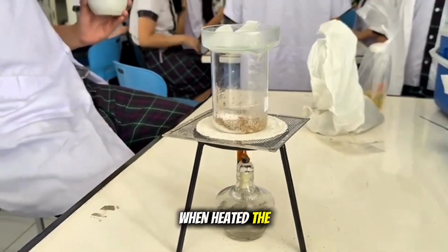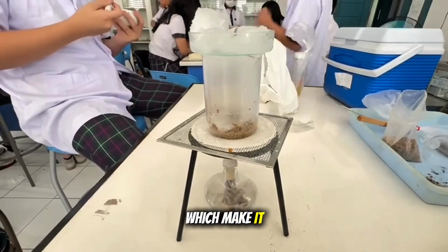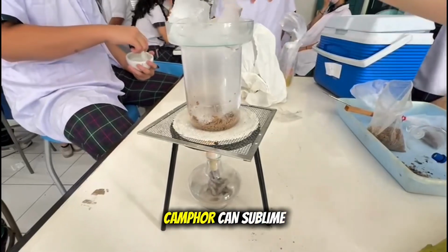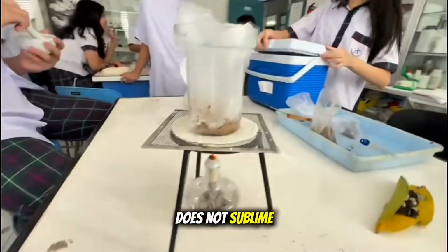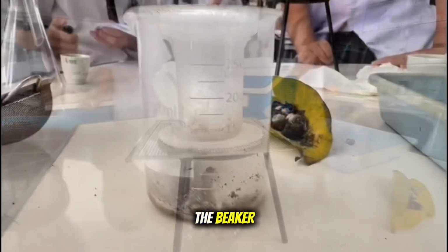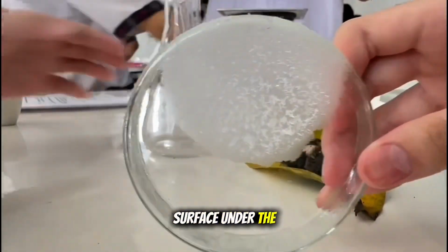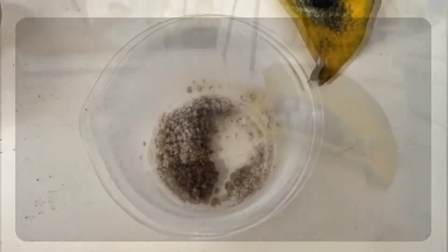When heated, the camphor changes directly from solid to vapor, which makes it look like the camphor disappears. This happens because camphor can sublimate. The soil, however, does not sublimate, so it stays as residue in the beaker. The vapor then reaches the cold surface under the ice and condenses back into white crystals.